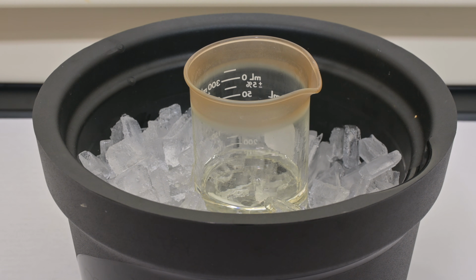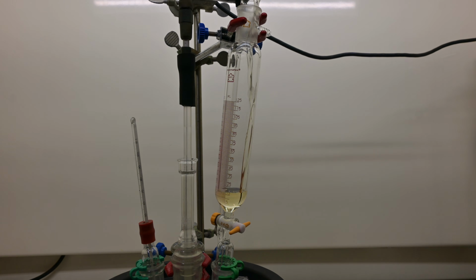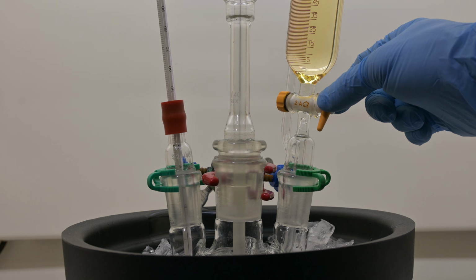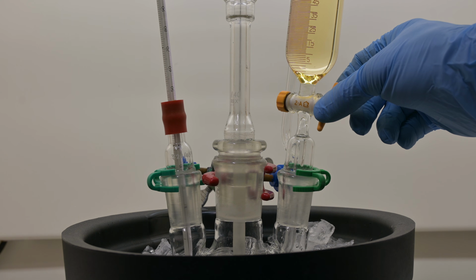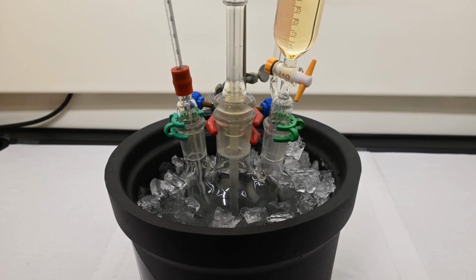Once both the sodium nitrite solution and this acid alcohol blend are nice and cool, it's time to bring them together. We then transfer the alcohol mixture into a separatory funnel, and then very slowly add it to the nitrite solution, aiming to keep the overall temperature steady at around 0 to 1 degrees Celsius. Adding slowly is the key here. As soon as the sulfuric acid meets the sodium nitrite solution, nitrous acid forms. If this addition is rushed, you risk creating nitrogen oxides or triggering unwanted side reactions.